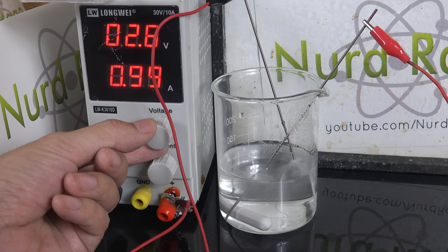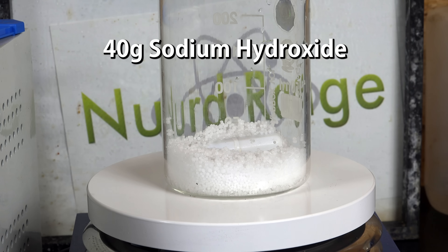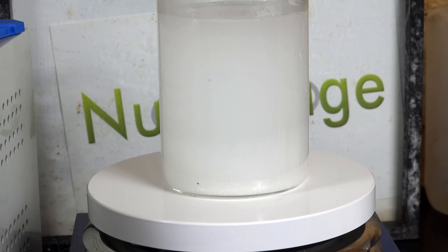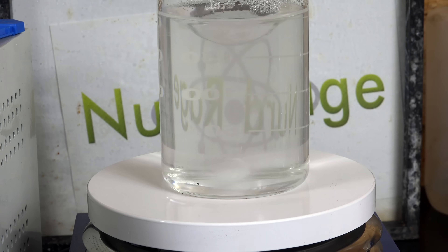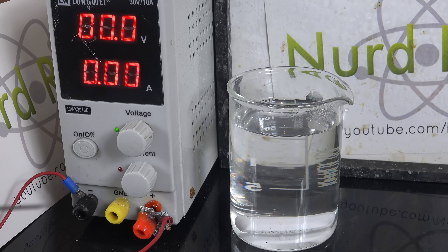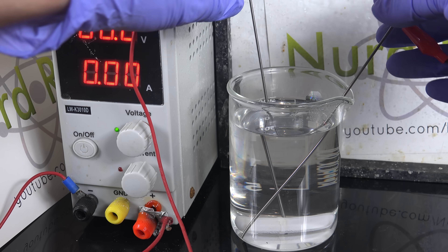So we're going to use a simpler and safer approach by applying our favorite and most powerful oxidant known to science: electricity. To do that we first make our electrolyte of 40g of sodium hydroxide dissolved in 200mL of water. When we apply electricity to this solution it will dissolve tungsten and thorium, but the thorium will precipitate out. I selected this quantity because I weighed my tungsten rods to be about 60g, so this amount of sodium hydroxide should completely dissolve them. You'll need to adjust your quantities if you're using more or less. Now set up the electrolytic cell with a constant current power supply, and we use thoriated tungsten rods for both our anode and cathodes. Only the anodes will dissolve, so you can use a copper or carbon cathode if you want — I'm using tungsten rods for convenience.